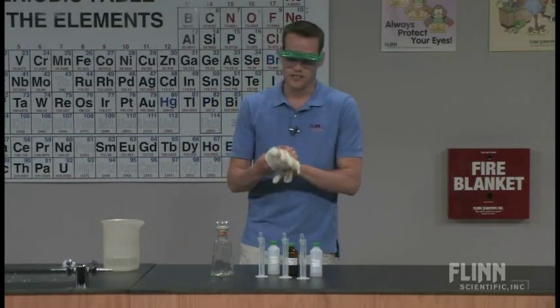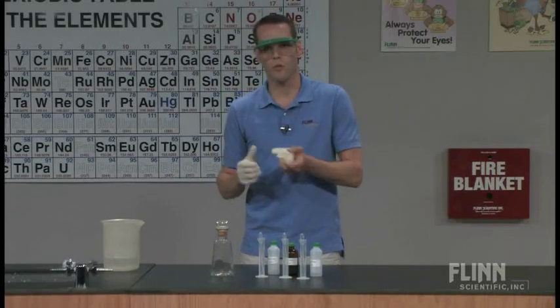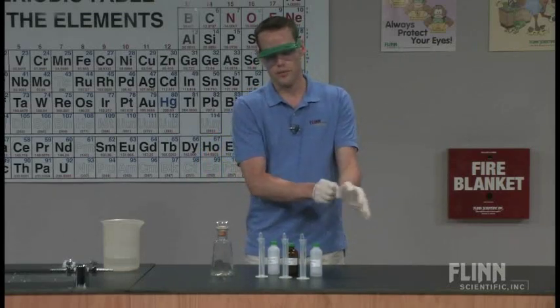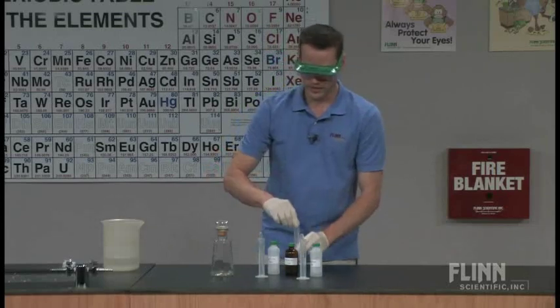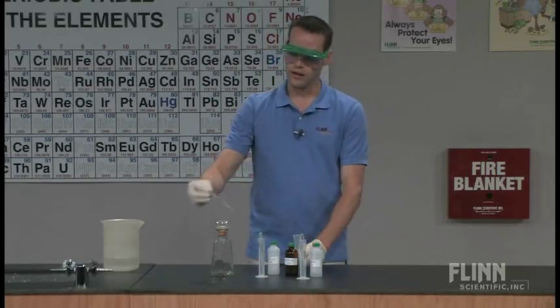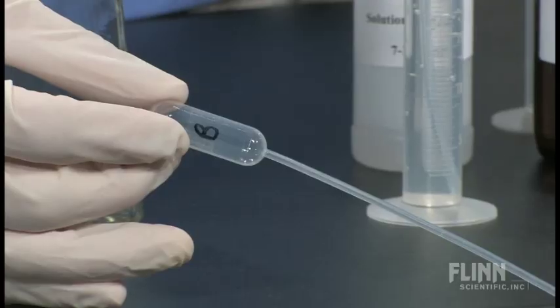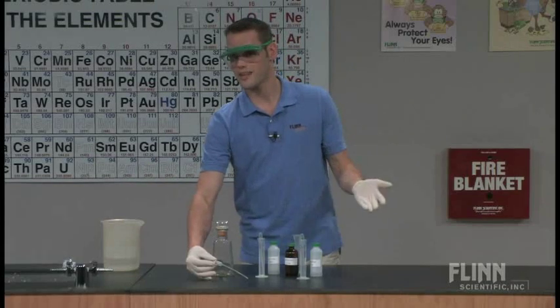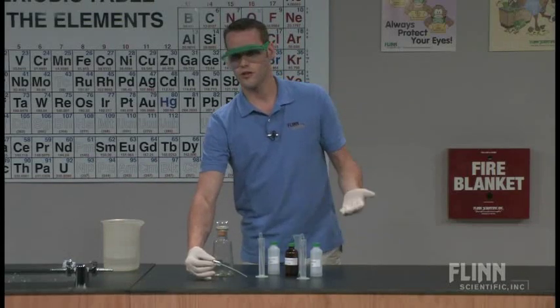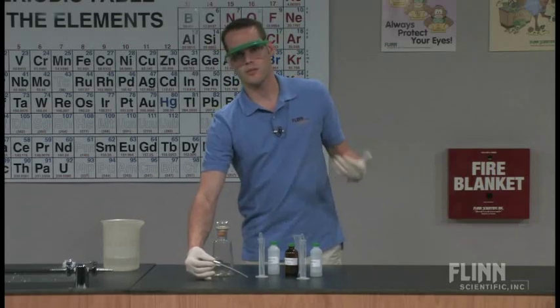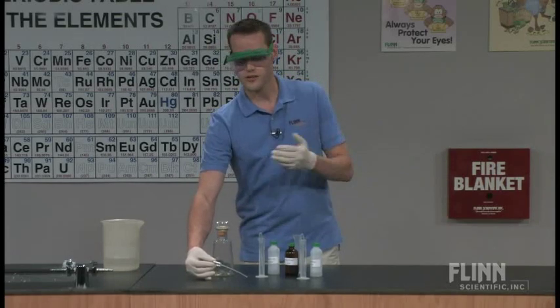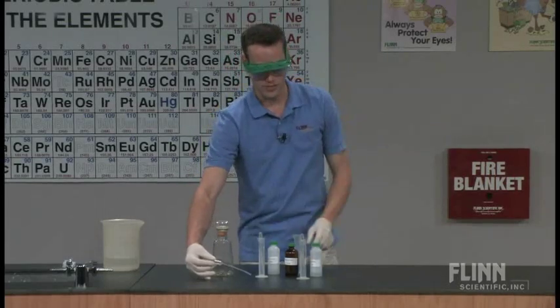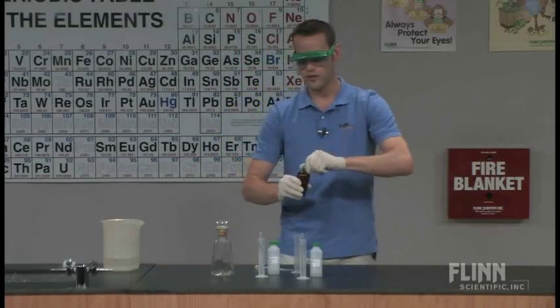If they do get the black marks on their skin it's not a huge deal, it's not permanent, the skin will wear off over time. But you can have students wear gloves so that they don't have that problem in the first place. So I label my pipettes every single one of them because if any of these reagents contact each other, particularly if B and C come in contact or if they use the same one, you end up with silver graduated cylinders rather than silver bottles. So I label the pipettes, I put out every station, I separate them by at least 5 feet so the odds of transfer are very small.